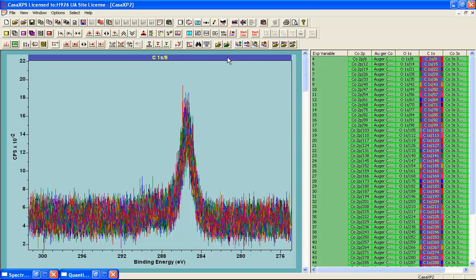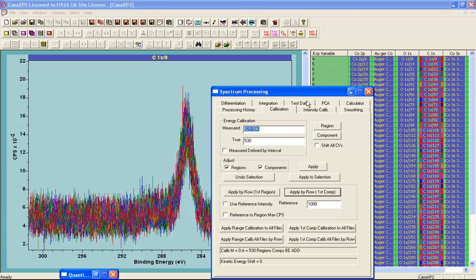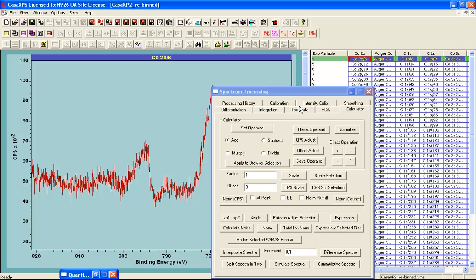So now we can do one further operation that is on the spectrum processing dialog window. And this is on the calculator property page. We need to rebin these spectra, because what we're going to do is calculate the sum of each column to produce a single spectrum for each one of these narrow scan regions. And in order to do that summation, we need to rebin the data so that the summation is a simple sum of each data bin. So when I press the rebin selected VAMAS blocks, a new data file is created. And these are now the rebin spectra, as indicated by the name.